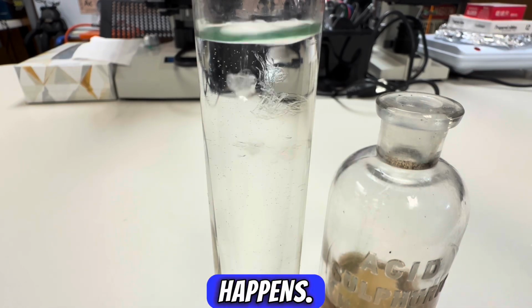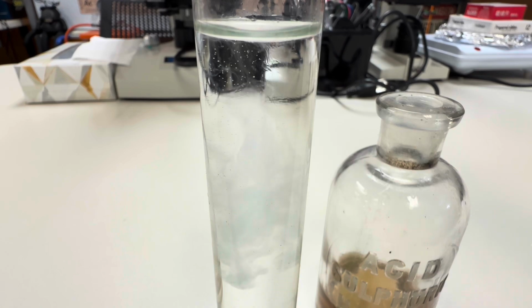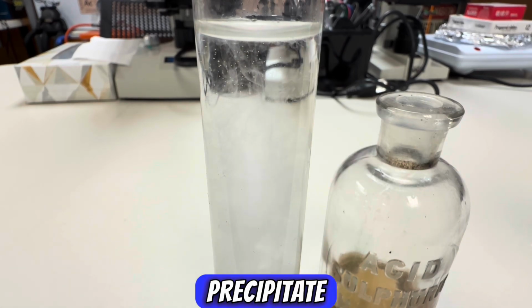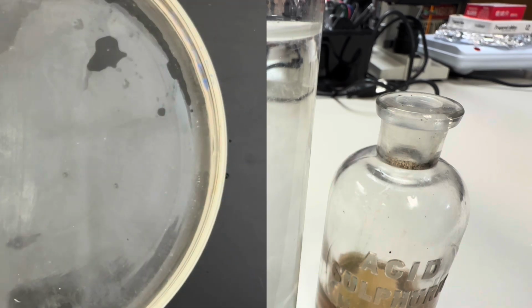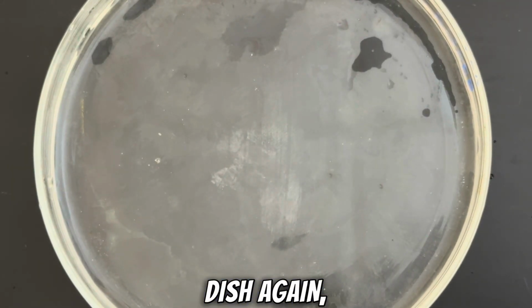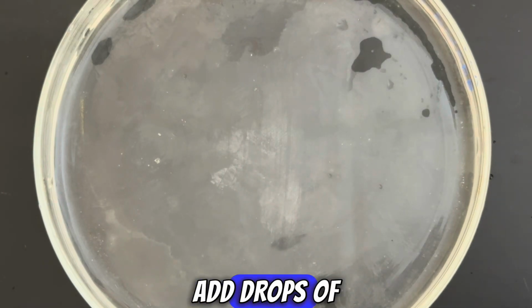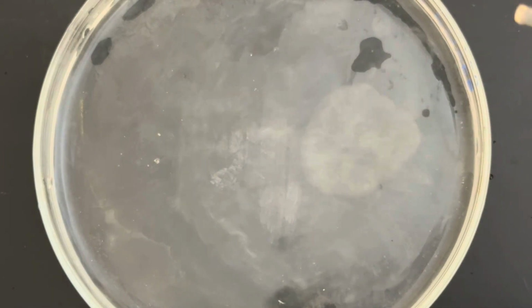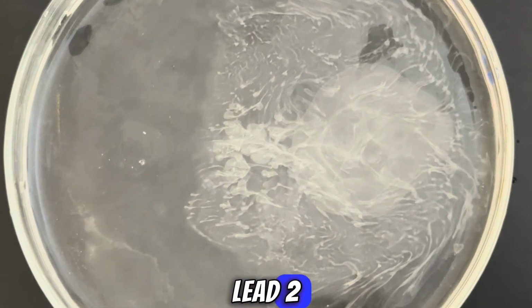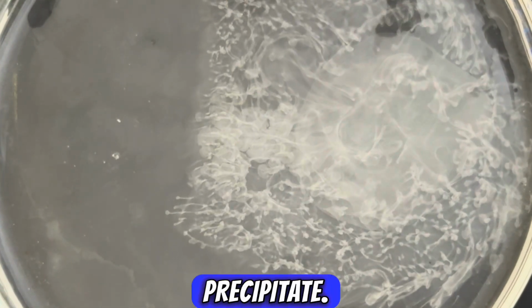Let's see what happens. Look at that. You can immediately see that white precipitate fall out of the solution. Let's take a look at that same reaction now in the petri dish. Again, I'm going to add drops of sulfuric acid, and immediately you can see that white lead 2 sulfate precipitate.